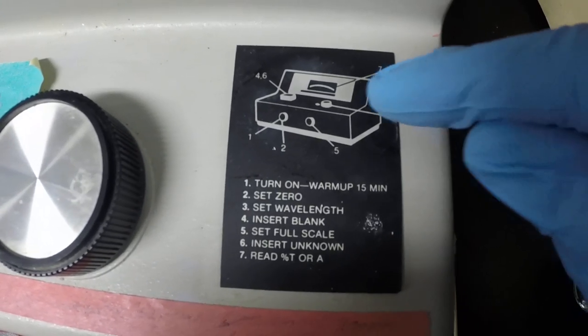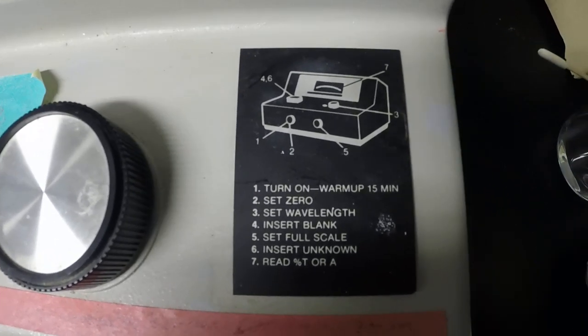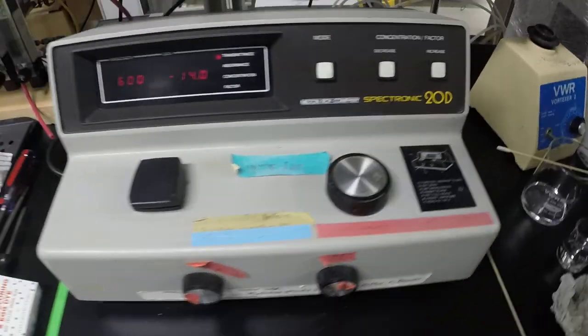Step three is the wavelength, that's the bigger knob here, and then the final spanning is done over here on number five.